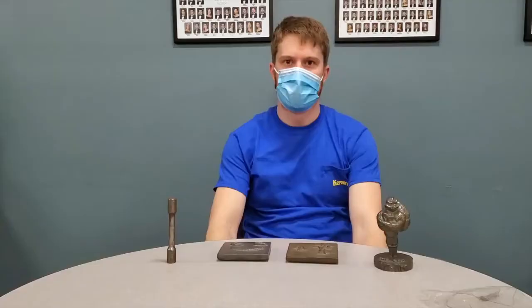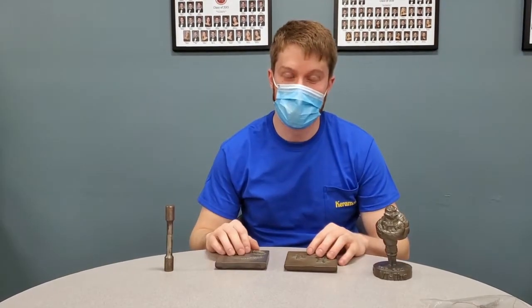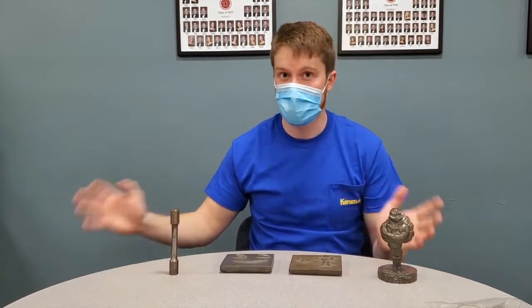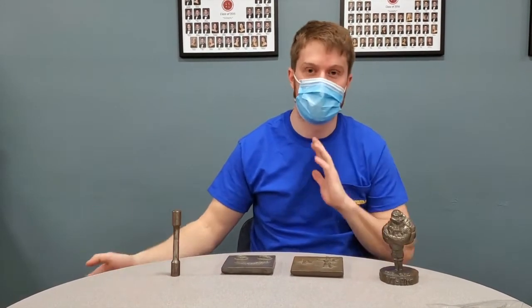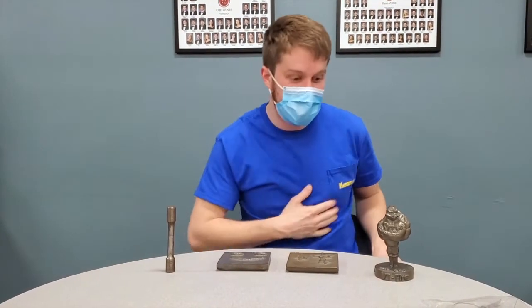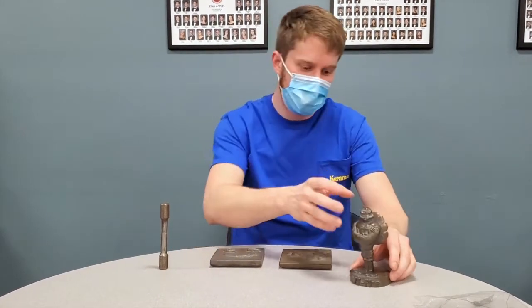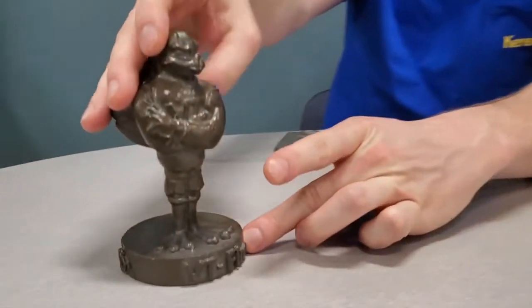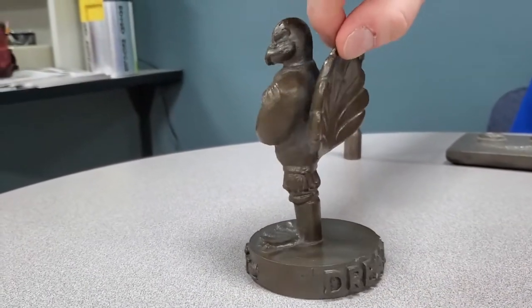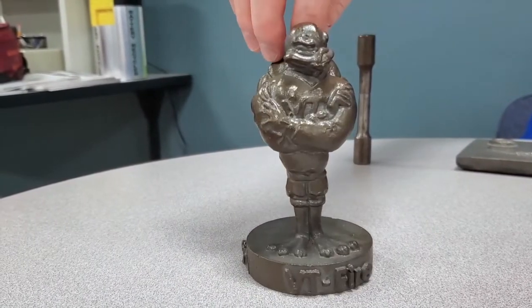Hey everyone, another one of the really cool opportunities we have at Tech here is the opportunity to work with the foundry. We have a pretty large scale, medium scale metal processing and casting department. It's run by Dr. Druschitz, and these are some of the things that were made. This is a hokie bird. That was an investment cast, and it was cast out of, I believe, steel. And then it was painted, covered with an enamel to protect it.